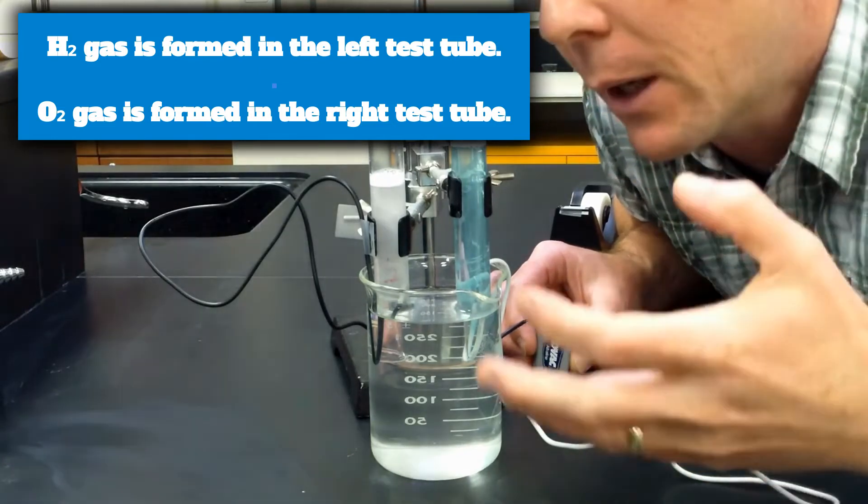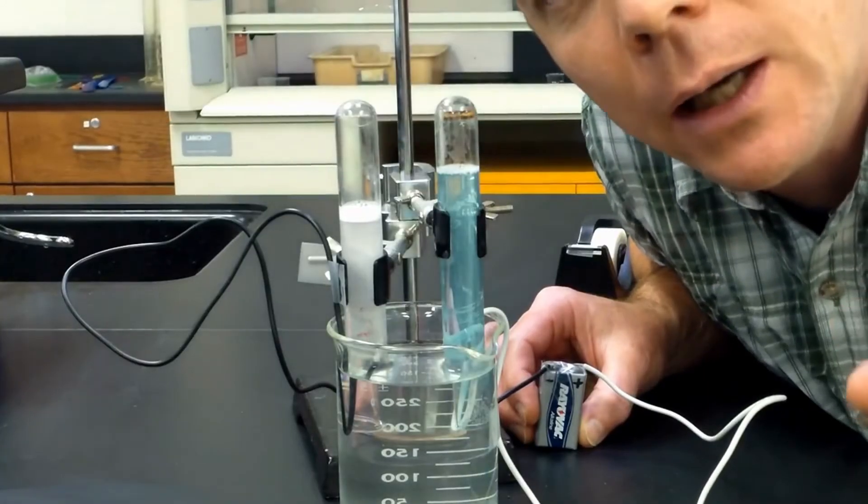So I can see here that I'm getting a volume of gas. At the cathode is hydrogen.